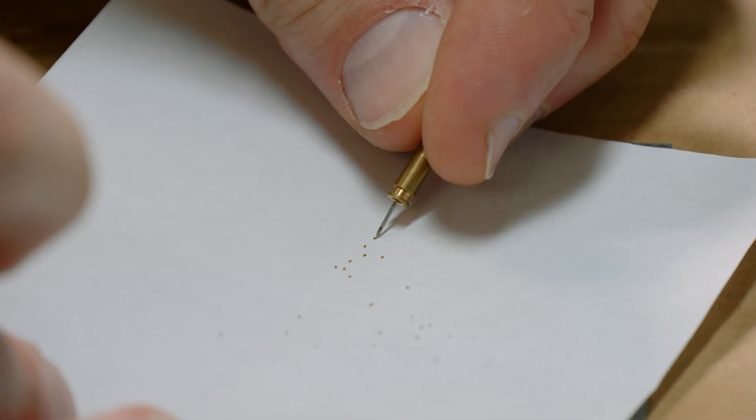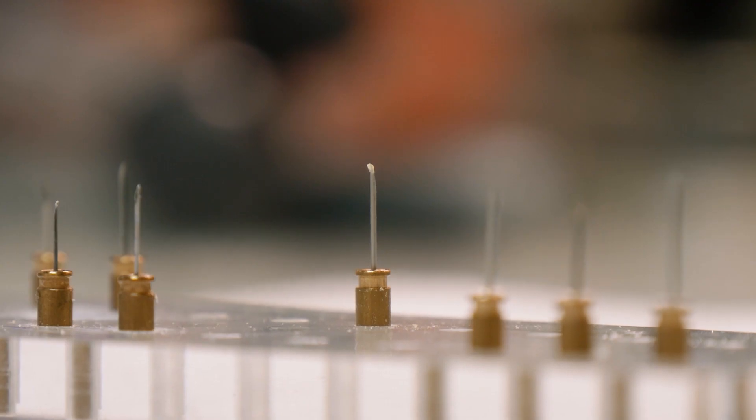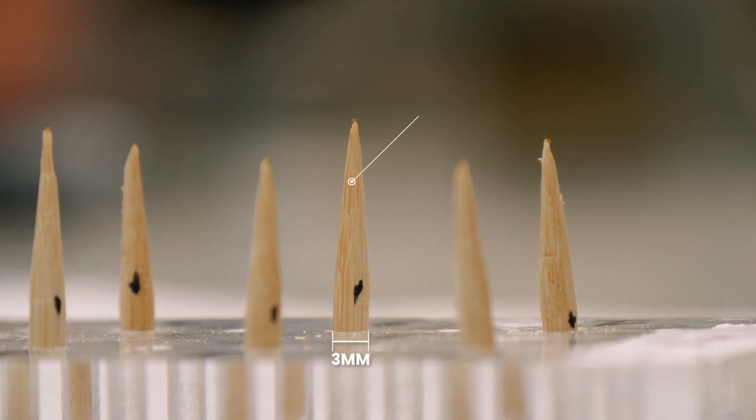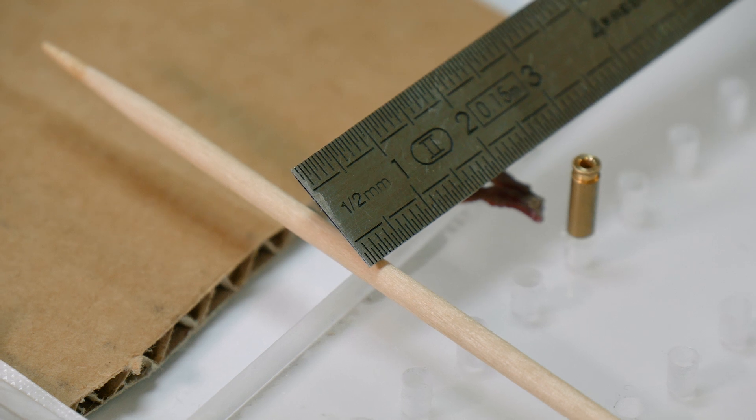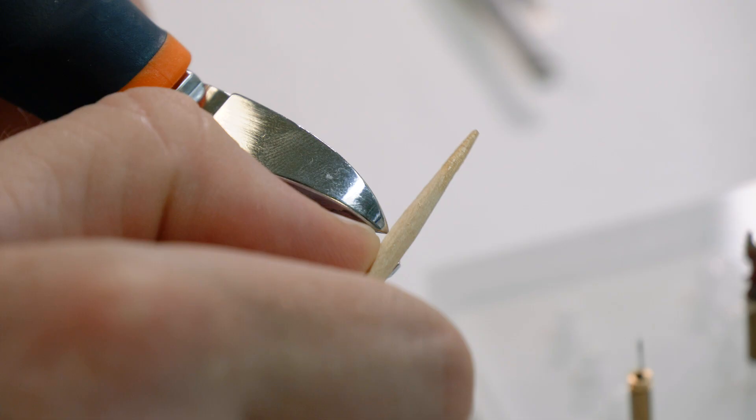We pick a seed. A wood pin of diameter 3 mm can be used instead of the needle. We cut all samples to the same length.